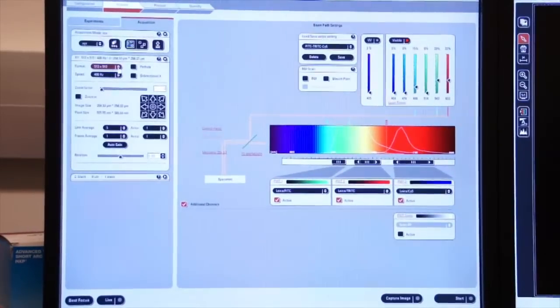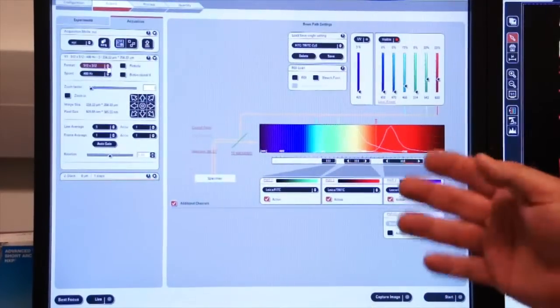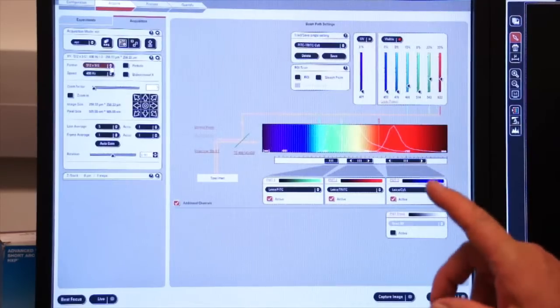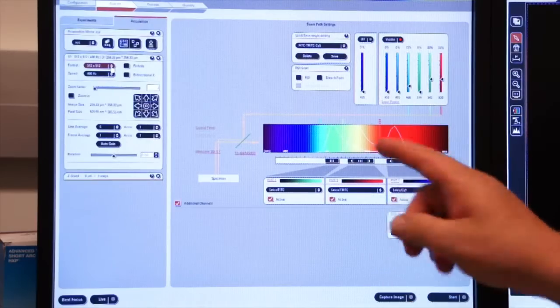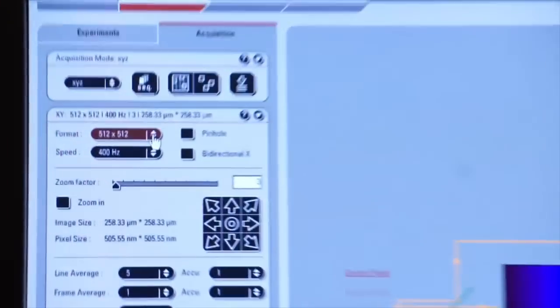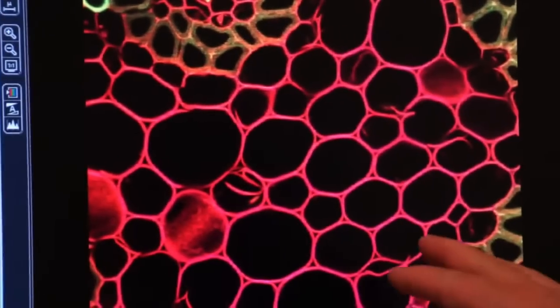We won't take much time to discuss the different resolutions available. You'll learn that when you come in for hands-on training, but I do want to show you the dramatic difference between a low resolution and a high resolution image, both using line averaging. Here we're going to do a 512 by 512 image with 5 line averages. So I'm going to click on capture image. You'll see the image come up on the screen, on the right screen. Now you see the image forming.